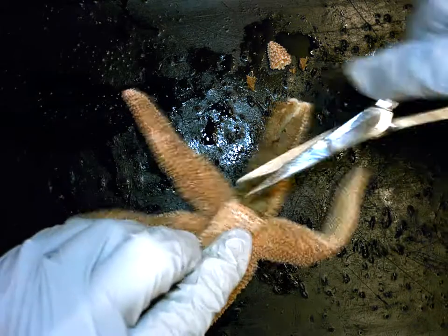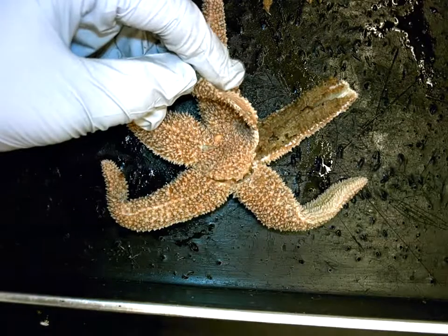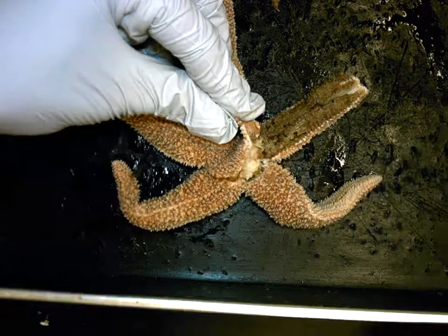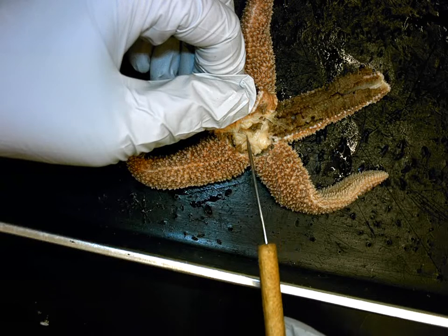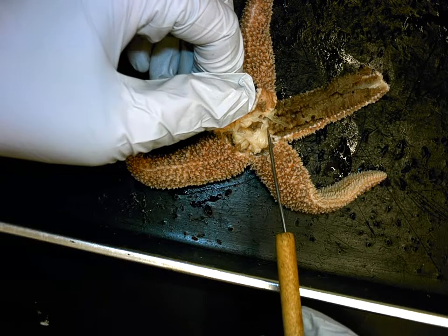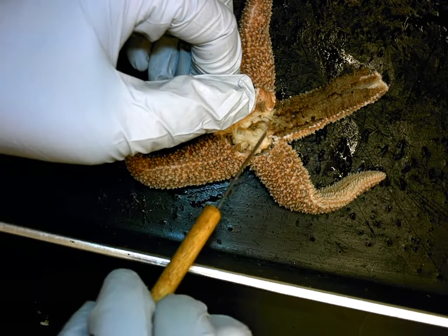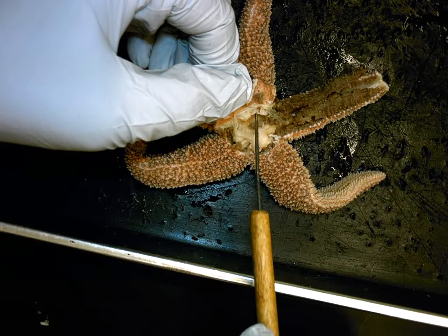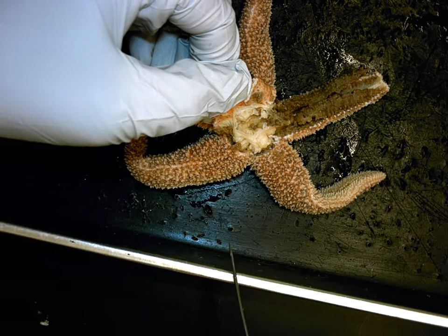Now I'm going to pull back a little bit further and see what's in the center area of the animal. As I angle it to the side, you can see there is this tiny circular space created by a membrane. This thin membrane is actually creating a chamber, kind of like the dome of a tent. That chamber doesn't do mechanical digestion, but actually does chemical digestion. In a sea star, we call this stomach chamber the pyloric stomach.